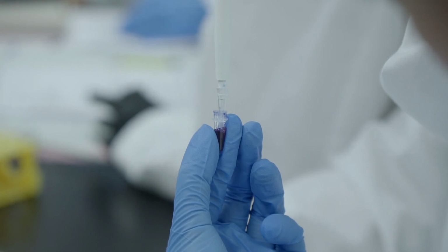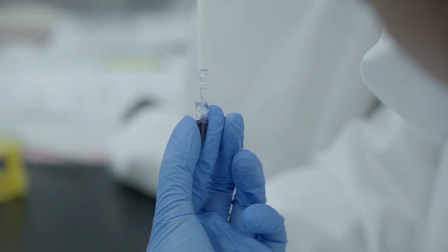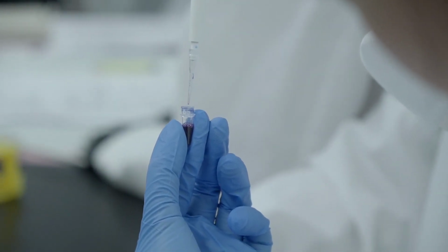Oh, I forgot the tops. Sorry. Can you come with me really quick? Rachel, we'll be back in 30 seconds.